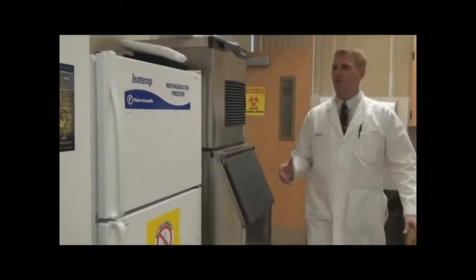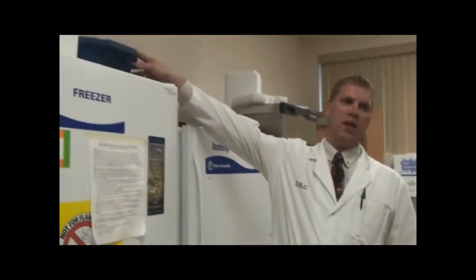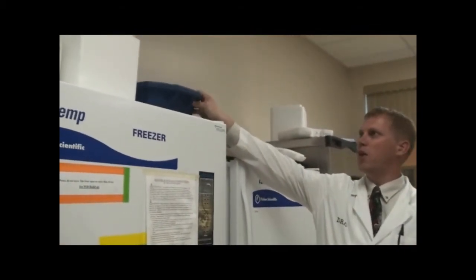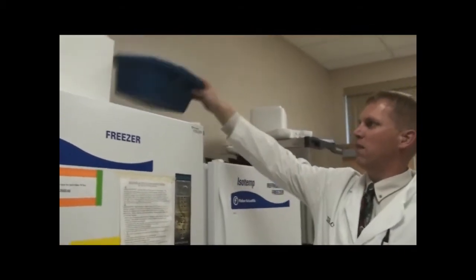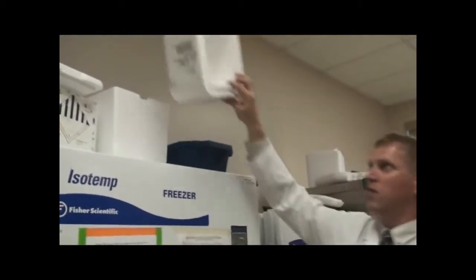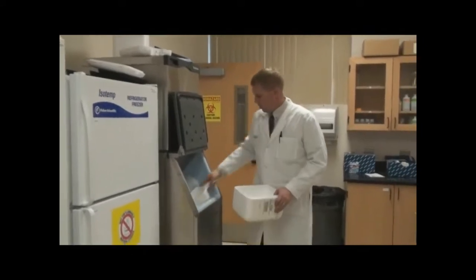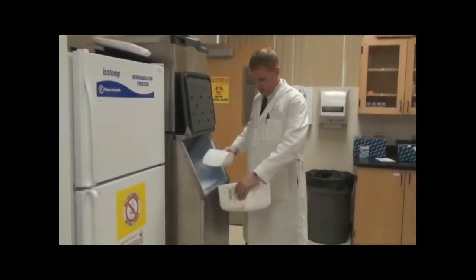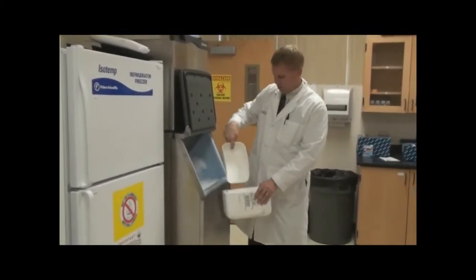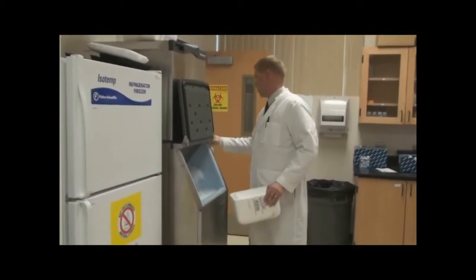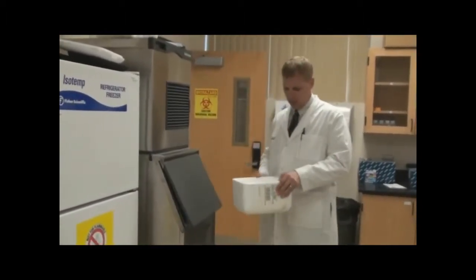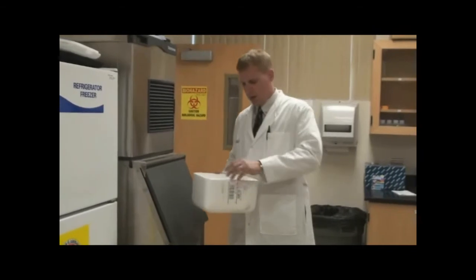So the back room is where we store our ice buckets. They're usually located here on top of the refrigerator. It doesn't really matter, you can get the fancy fabricated ones or just a styrofoam box will work. And I'm going to come in here and grab some ice, and that's it.